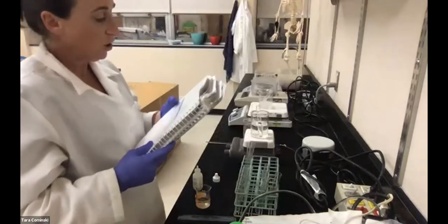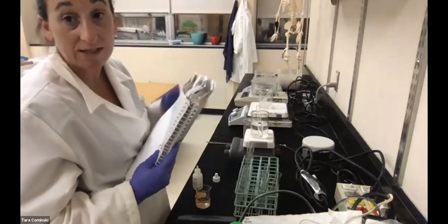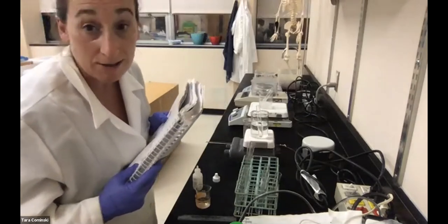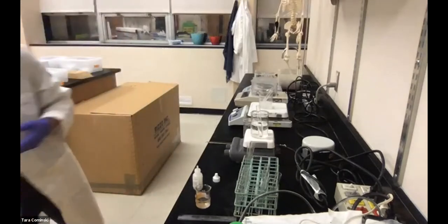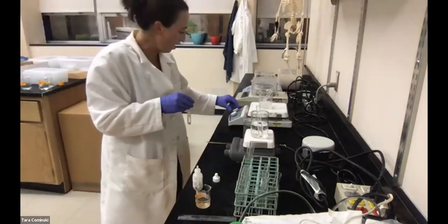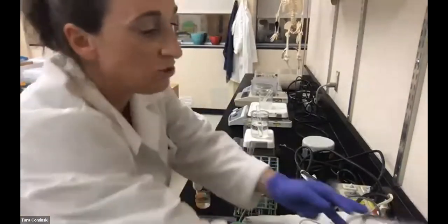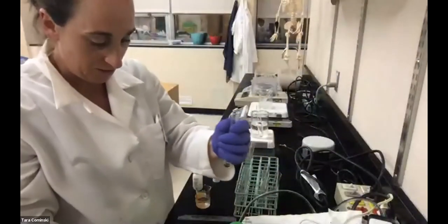So for tube 1, I've already had them incubating for 15 minutes in each of those conditions, each at a different temperature. Now, I need to add the hydrogen peroxide. Let's see what the bubble height is first for the refrigerator one. Okay, so that's this guy here. Let's turn this off before I burn the place down. So here's the refrigerator one. I'm now going to add that hydrogen peroxide to it, and then we'll see what the bubble height is for this one.